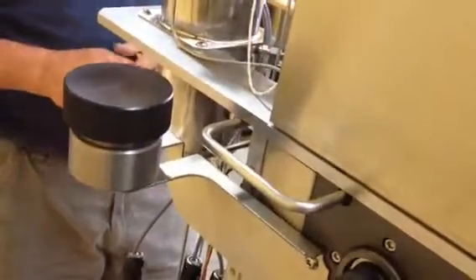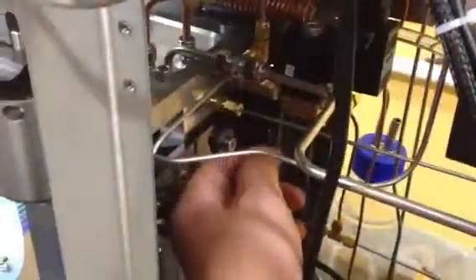There's a couple other fittings that are kind of hidden, kind of a little harder to get to. You might need the instrument turned right sideways. And that's anything coming off of this plate here. So you have the tube that comes up to Q6 right here. You have the fittings that come to Q7 and over to the safety valve, and also the tube coming up to Q5. Okay? These are all potential leaks. Another potential leak is on the exit of Q7. There's a 90-degree fitting that it could be leaking through. Sometimes the valves are cracked, leaking just a little bit. So look for residue at any fitting that I just explained.